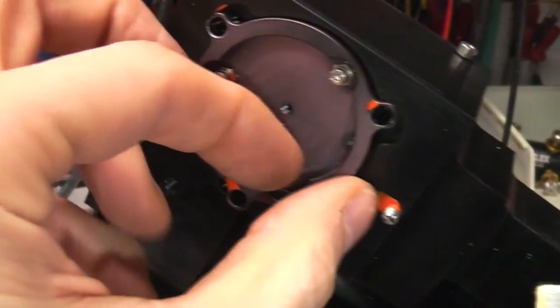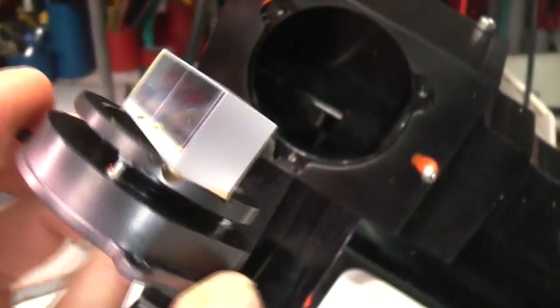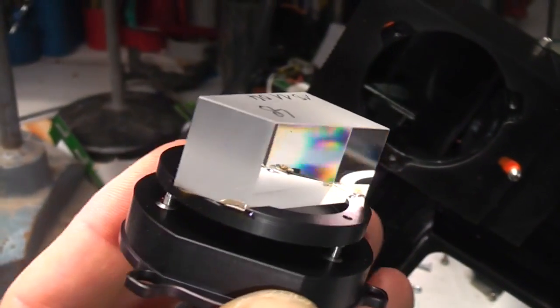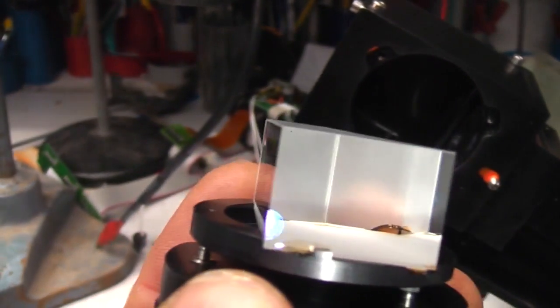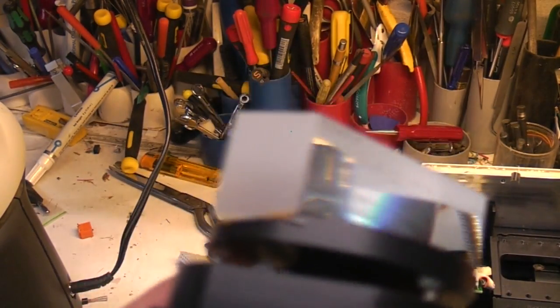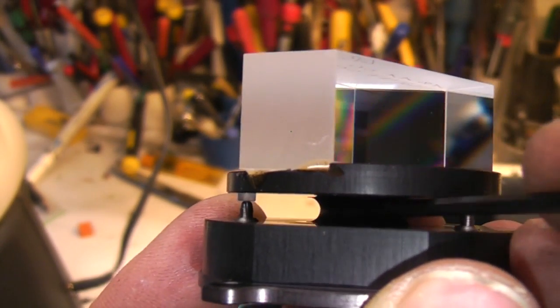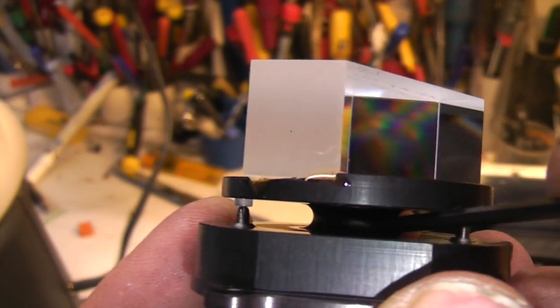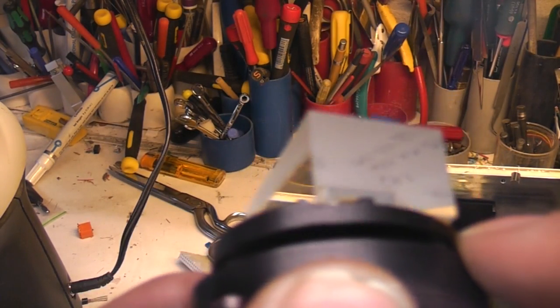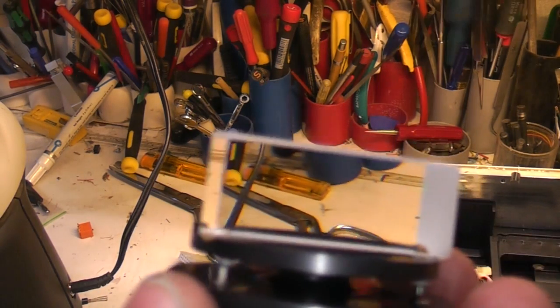And behind here we've got the prism. And you can see this prism's on a precision adjustable mount as well. This is actually just a solid piece of aluminium that's been machined out to form this central section. There's these adjustment screws that just apply force to this platform to adjust the prism angle precisely. And you can see how this prism splits up the white light into its pretty constituents.